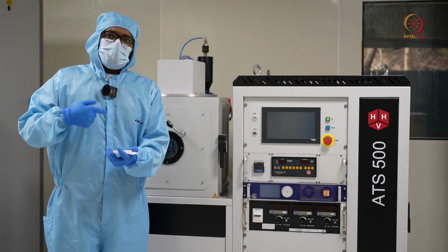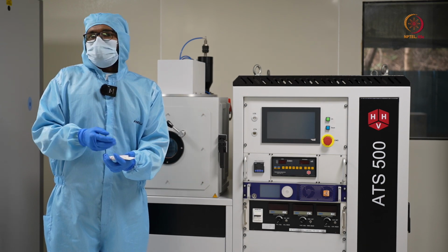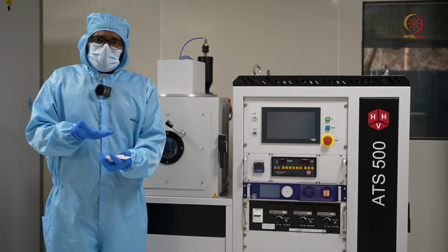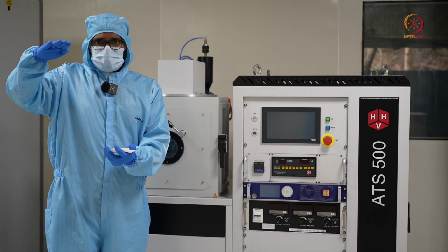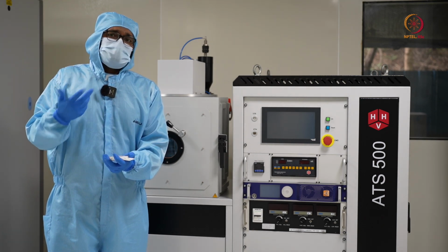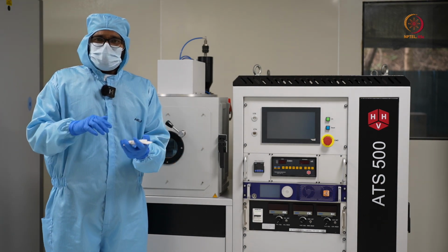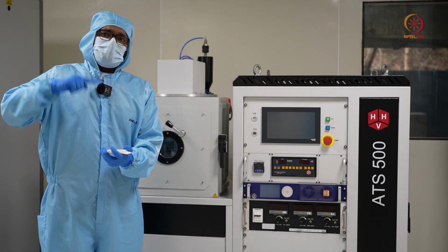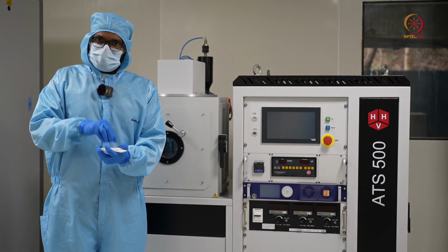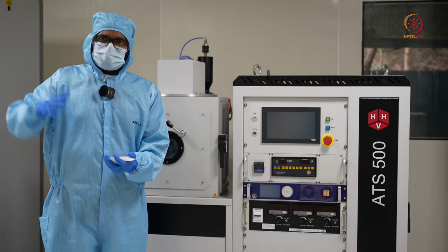When you do this multiple times for a long time, these dislodged particles will, due to the kinetic energy, move upwards, and on the opposite electrode you will have your sample, where you actually want the coating to happen. So this is the basic principle. You pump in argon gas, apply a very strong electric field, create a sustained plasma, and this plasma will dislodge the particles from your source, and these dislodged molecules will go and stick to your substrate.